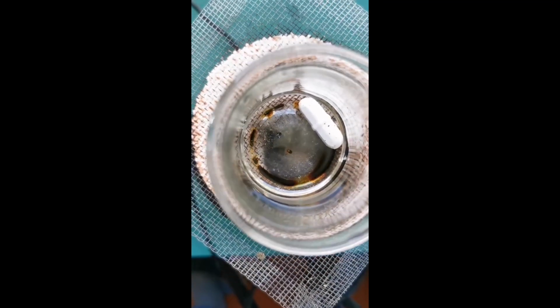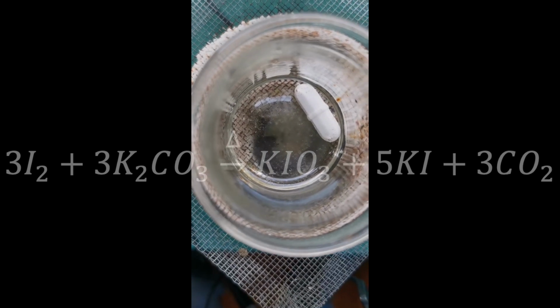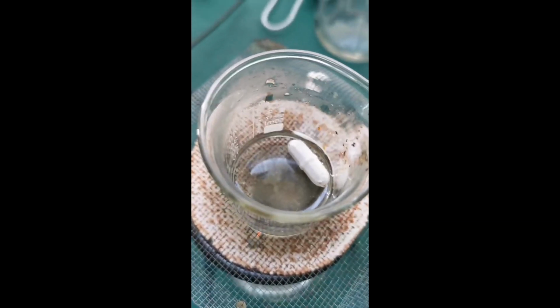The brown iodine at the bottom of the beaker slowly separates out into the solution, and eventually fades away completely. The iodine reacts with the potassium carbonate to produce potassium iodide, potassium iodate, and carbon dioxide. This allows us to recycle the iodine completely by dissolving it in the water.